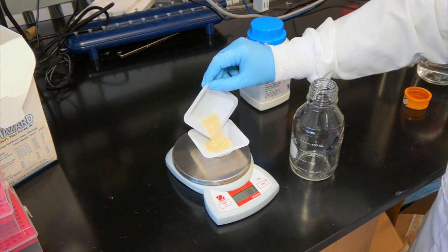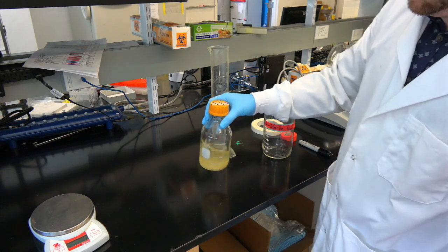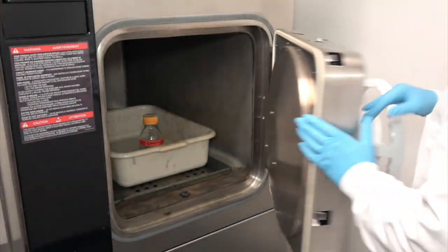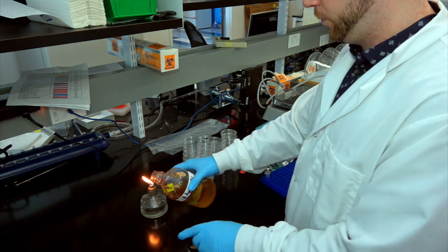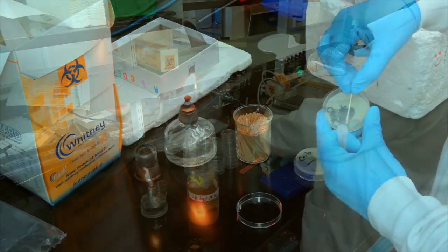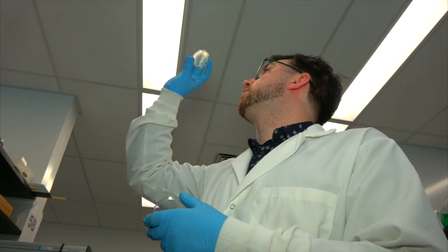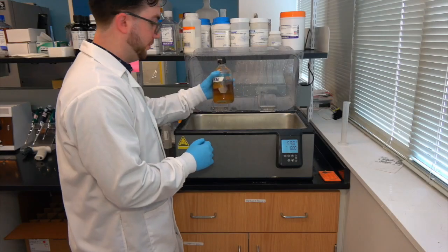In this video, we'll walk you through the steps for making LB agar plates. We'll show you all the materials you'll need for the process, show you how to sterilize your plates, indicate best practices during plate pouring, and demonstrate how to test your plates. By the end of this video, you should be able to prepare LB agar plates with your antibiotic of interest.